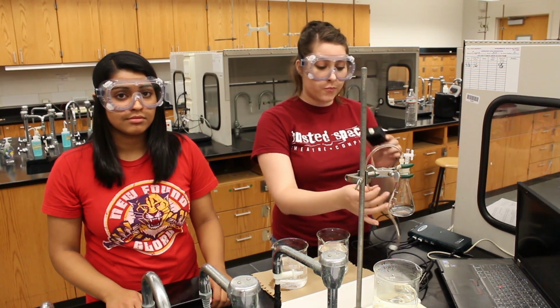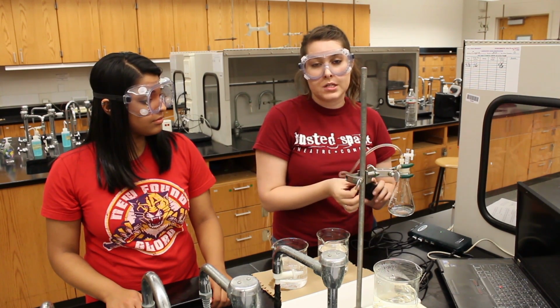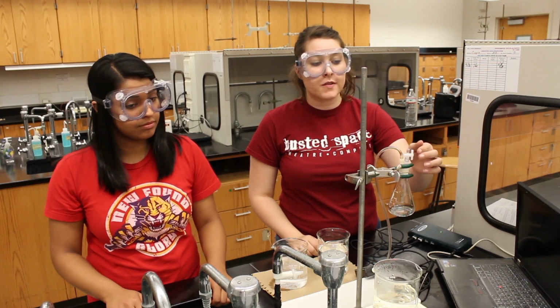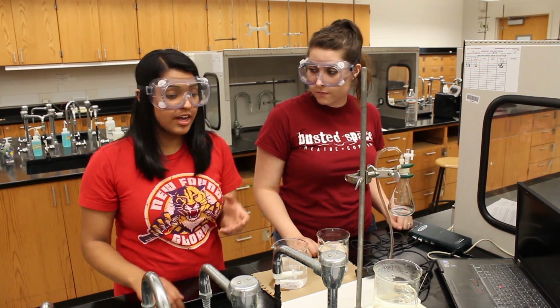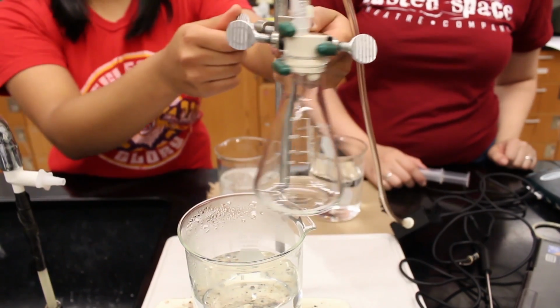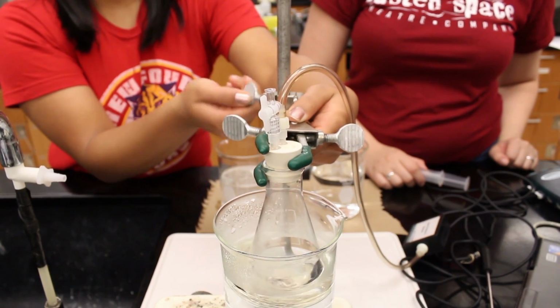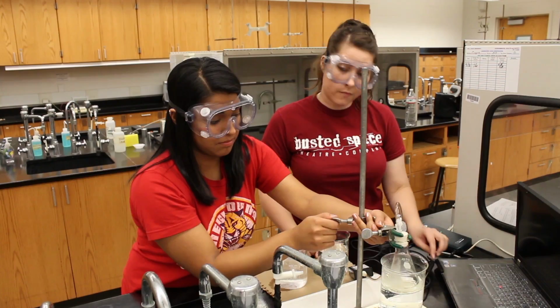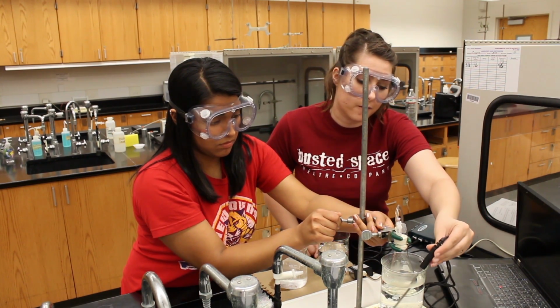Next, you'll want to attach the pressure sensor to a rubber stopper and place that rubber stopper into a 125 milliliter Erlenmeyer flask. Make sure that the gas valve is in the open position. Now, be very careful and hold the Erlenmeyer flask clamp and the ring stand and place the flask into the hot water bath, making sure that the tubing does not touch the hot plate. Next, you'll want to place your temperature probe into the hot water.